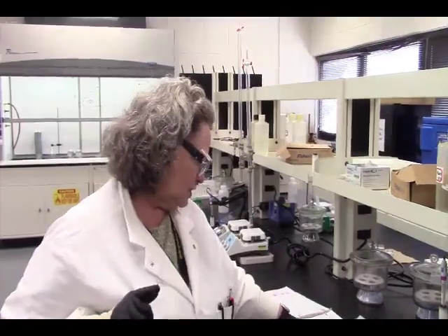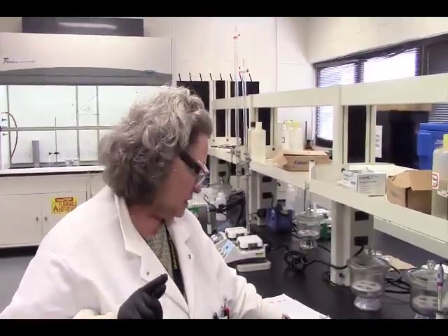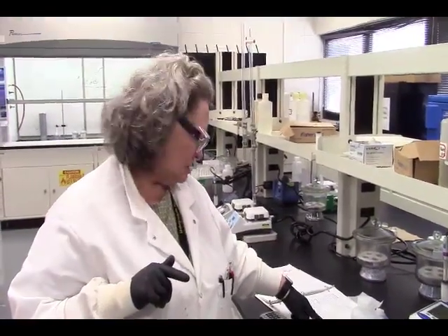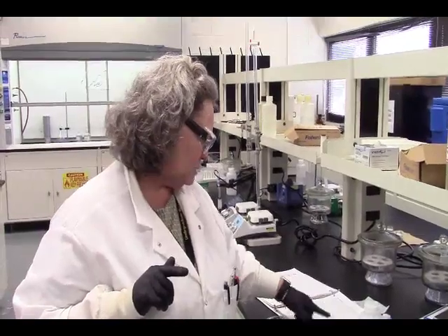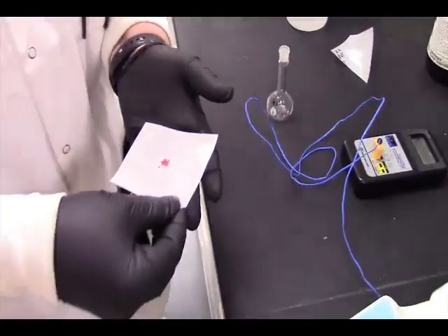So what I have to do is take my molarity, multiply it by the volume to cancel out my liters. So that means the volume has to be in liters. Then I need my molar mass to multiply that by the number of moles, so that I can actually get the gram amount that we need. So we came up with 0.0306 grams, which is right here. That's what it looks like.